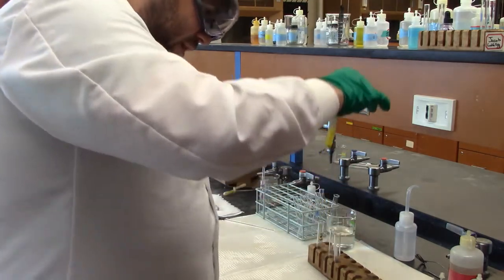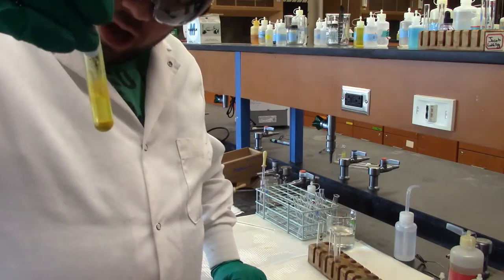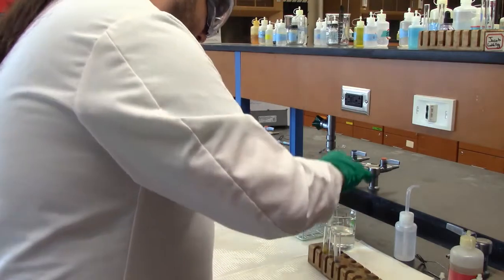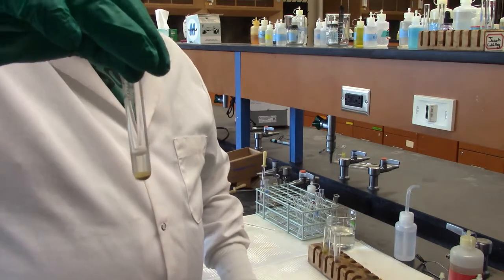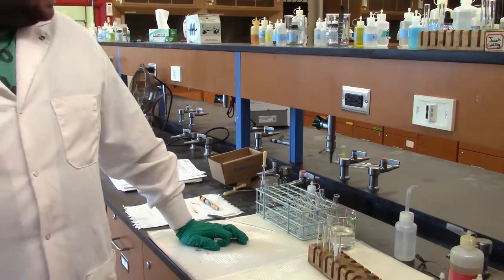Let's get out the cadmium again. That has also fallen to the bottom. We got that nice yellow powder at the bottom and some stuff still floating in solution. And all the way from the beginning, here's our tin as that beigeish, brownish precipitate all at the bottom. So there it is. Those are the observations for our group 2 ions.